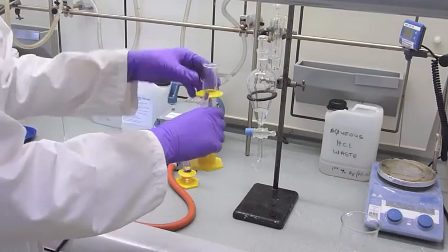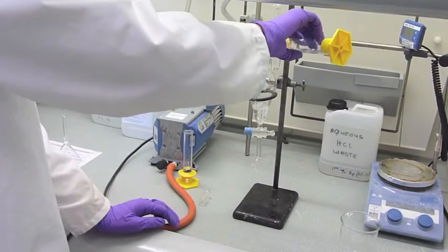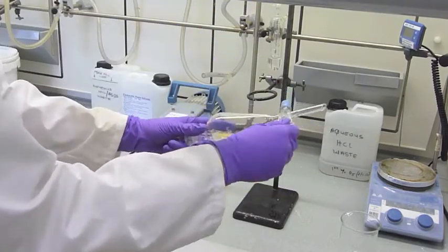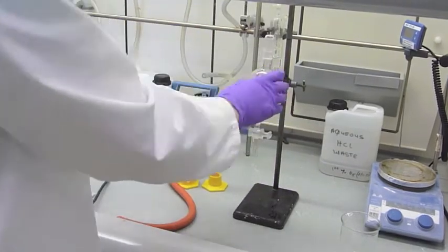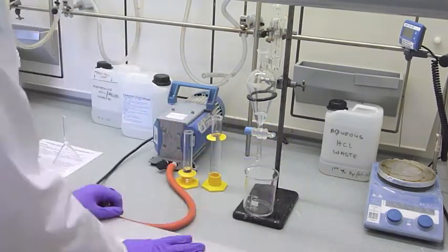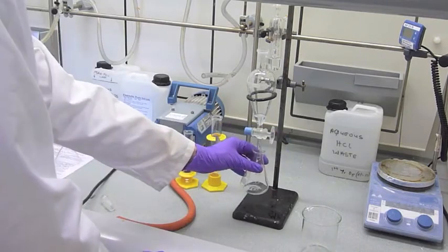The organic layer was then washed three times with water, sodium hydrogen carbonate, and then water again. At each step, the aqueous layer was run off, and then discarded.